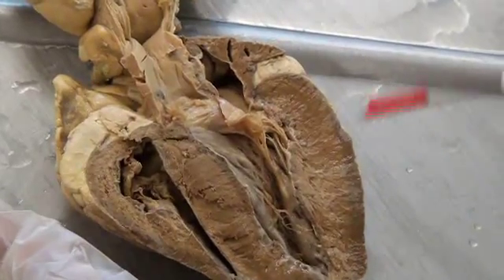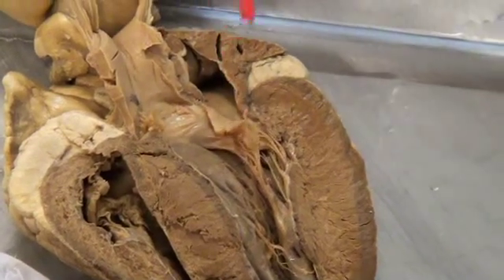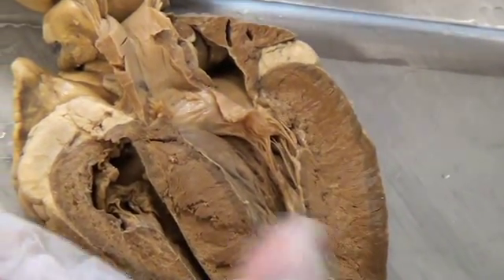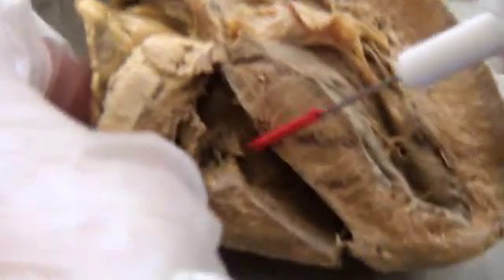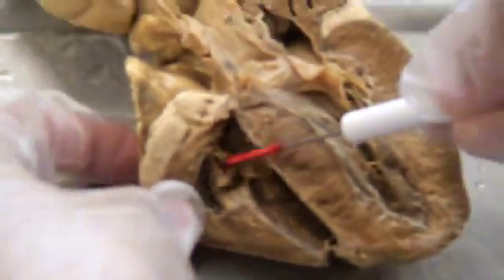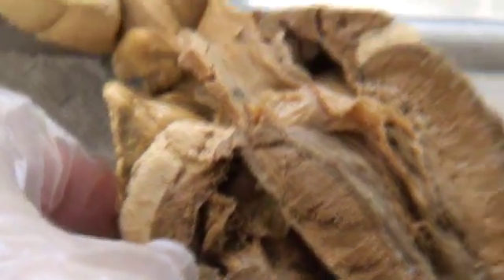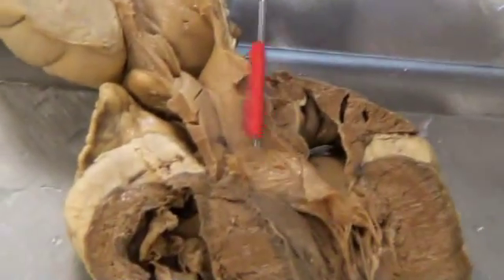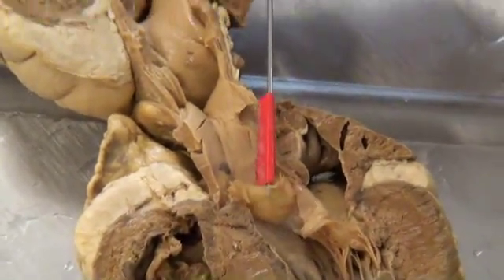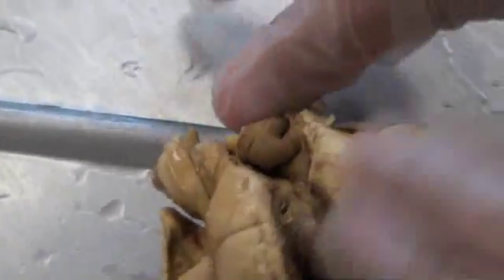Number nine is the bicuspid valve, which is right there. Number ten is the tricuspid valve. Let's see if we can open it up here. Number eleven is the aortic semilunar valve. Number twelve is the pulmonary semilunar valve — open that flap there, and it's right there.